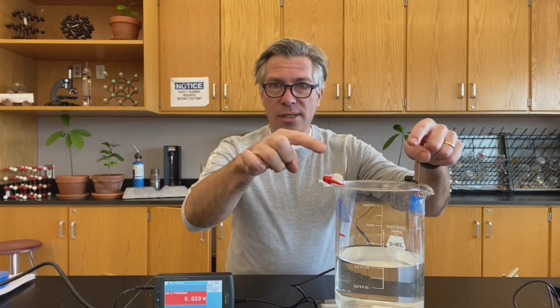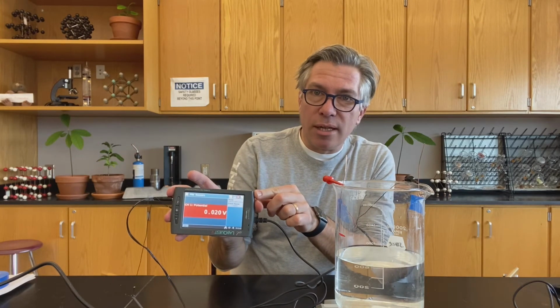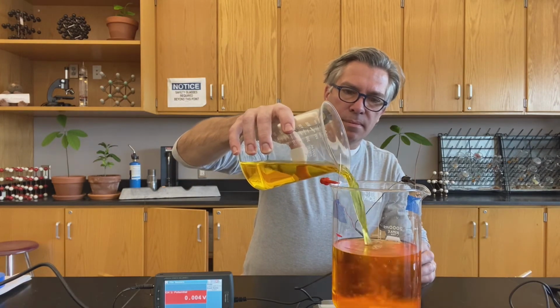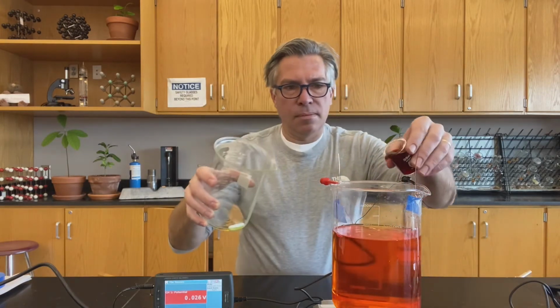Now I'm going to do something I've never done before. I'm going to run the reaction again, but this time I put a couple of copper wires in my beaker. They're down into the solution, and I've hooked it up to a voltage probe. And you can see already here I've got a small voltage happening between the 2 electrodes. And what I want to do is I want to see what happens to the electric potential as the reaction oscillates back and forth. In we go. Get it spinning.